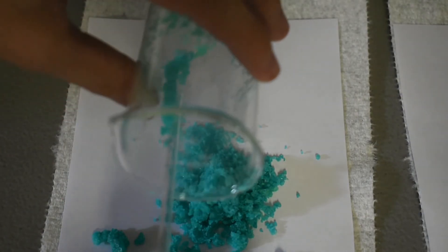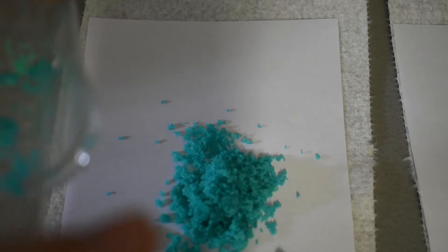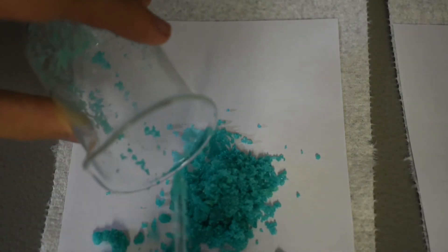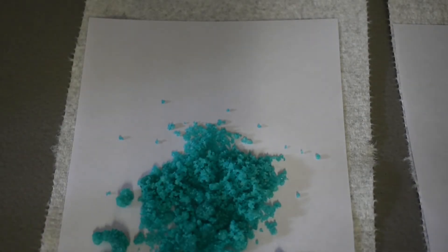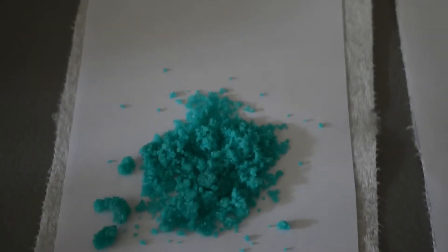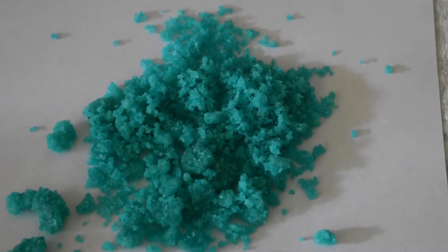I think I'll just keep them like this because I don't really need large crystals, but it's all personal preference. Here you can see what the crystals look like up close, really nice.